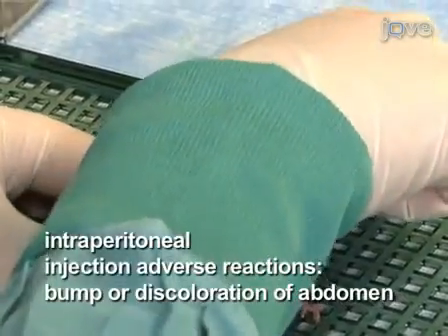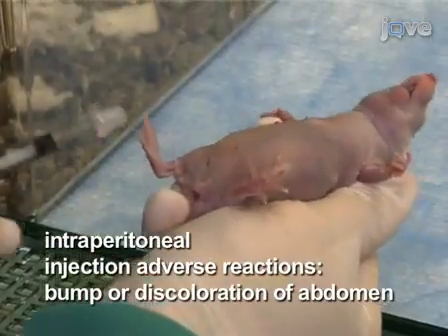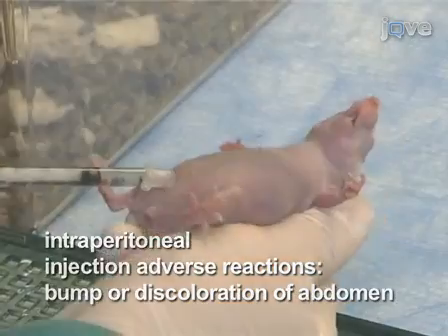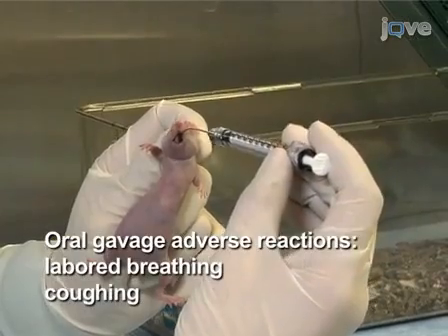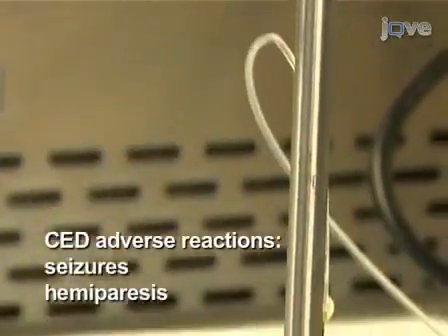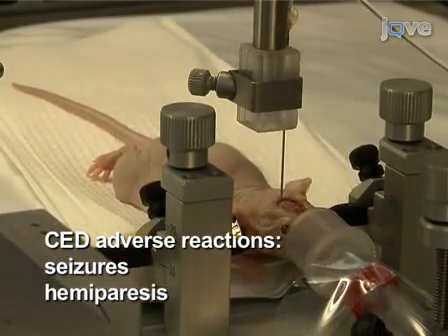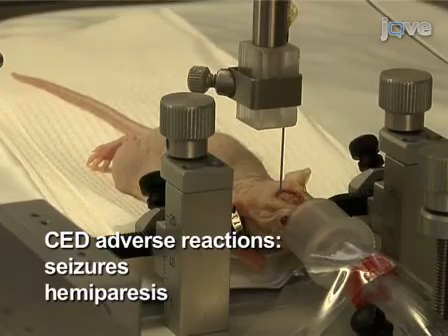For intraperitoneal injections, a bump on the skin or discoloration of the abdomen may indicate subcutaneous injection or damage to internal structures. In oral gavage, a mouse with laboured breathing or coughing may indicate that fluid was injected into the lungs rather than into the stomach. For CED, neurologic function is important for assessing successful administration of therapy. A mouse that is exhibiting seizures or hemiparesis may have received improper infusion.